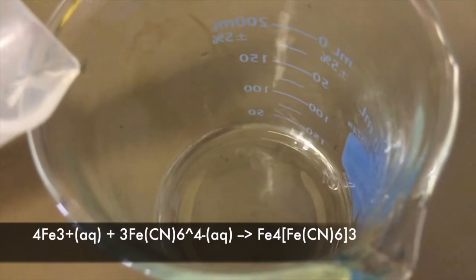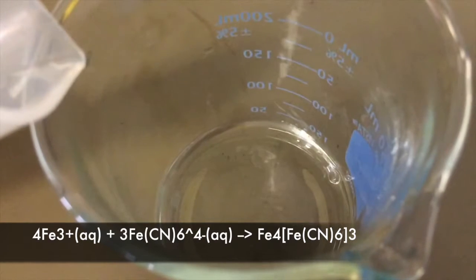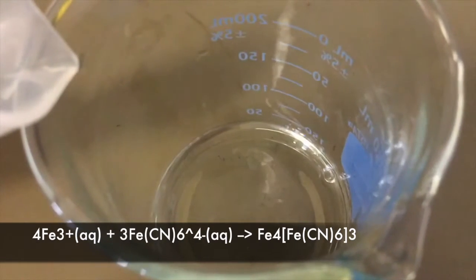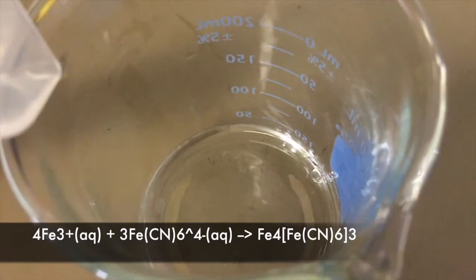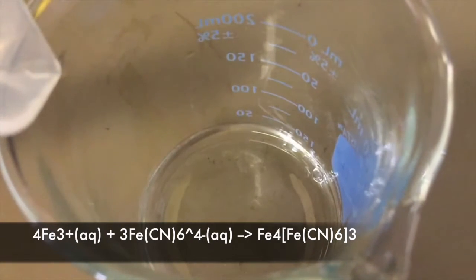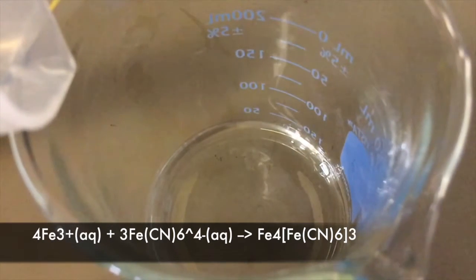In this reaction, the chlorine from the iron 3 chloride bonds with the potassium from the potassium ferrocyanide and stays aqueous in solution. The reaction that we are more interested in and will give us the blue color is the synthesis reaction between the Fe3+ ion and ferrocyanide. These two chemicals bond and give us ferric ferrocyanide.